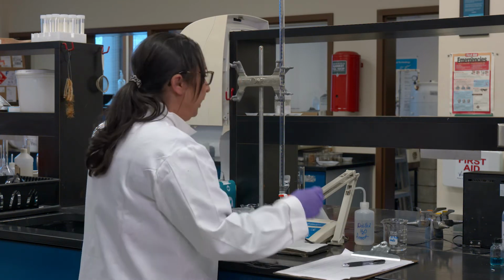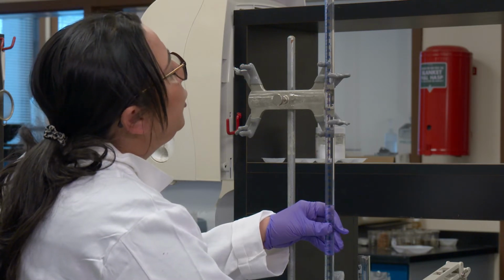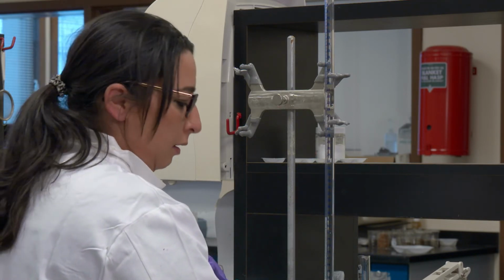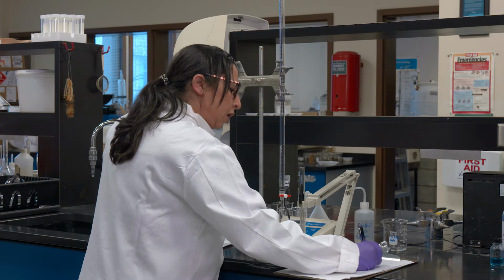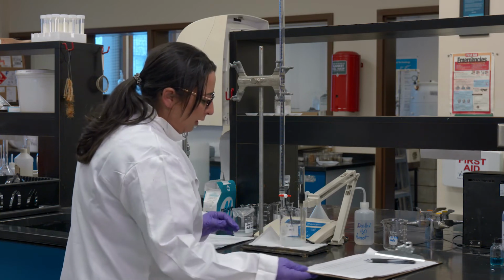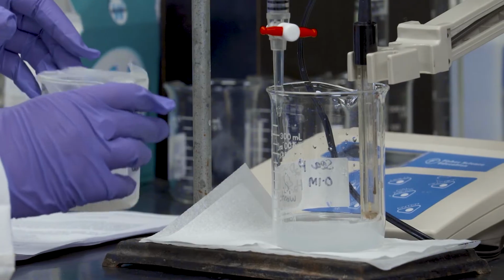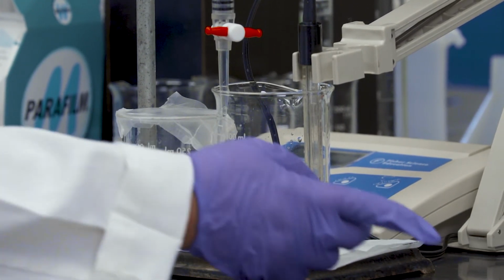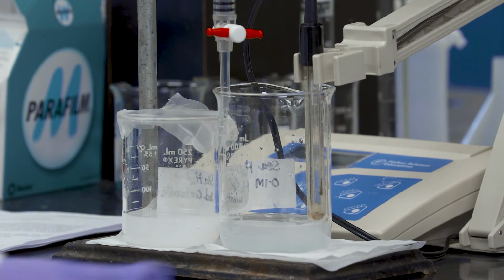I'm at 9.18, another mil, and this time I'm hoping I might shoot down somewhere close to 8, but let's see. So I have added so far 10 mils of the sulfuric acid, and if we can zoom in here and compare to this, the solution I started. I have started losing the cloudiness a little bit just because with 10 mils I have dropped down approximately 1 pH. Well, rather 2 I would say, because we're going to hit hopefully 8 soon.